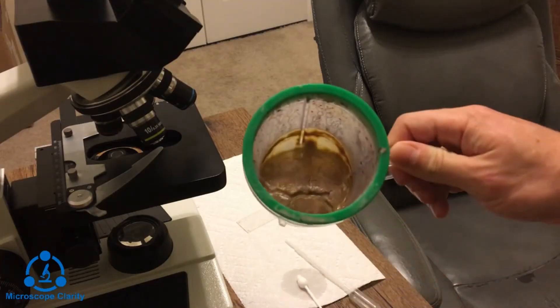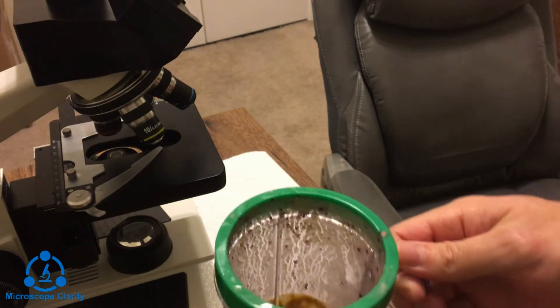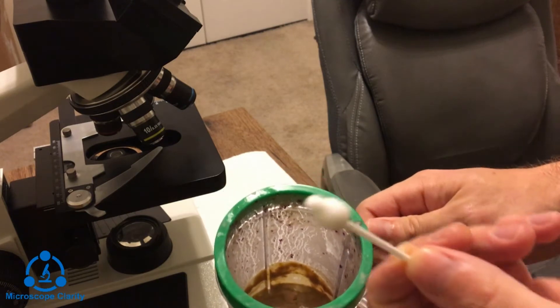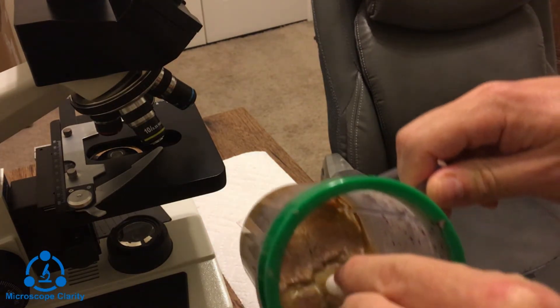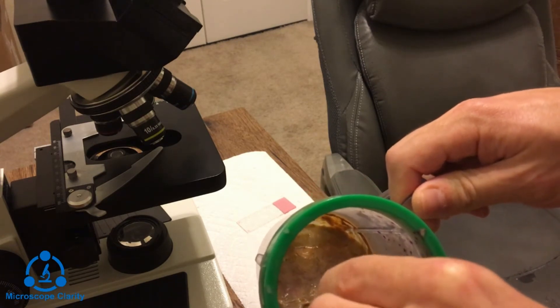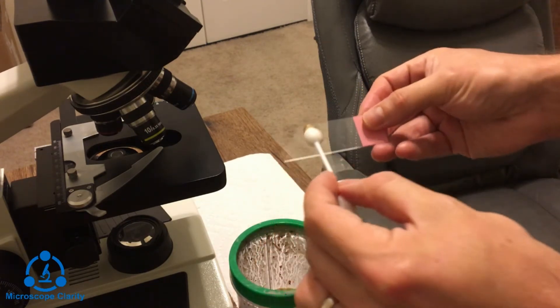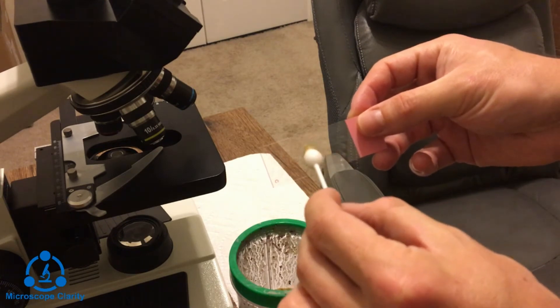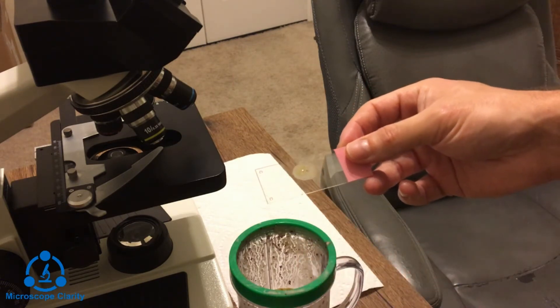And then we're going to apply a little bit of disinfectant and just see what happens. So here's the smoothie — it looks gross and disgusting. We're just going to take this Q-tip, which I wet just a little bit under the faucet, and grab a sample on the Q-tip. Then we're just going to apply it to the slide here and see what's on there.